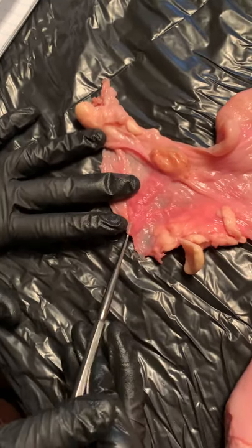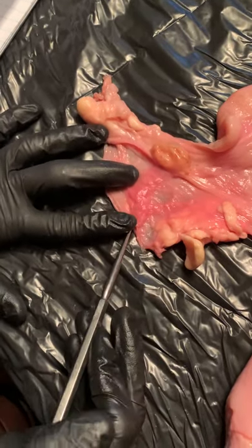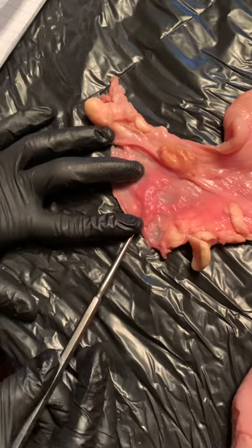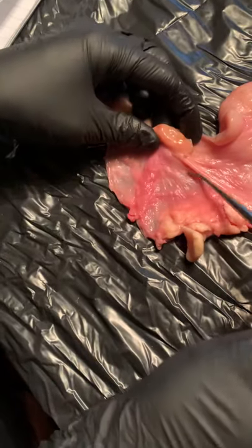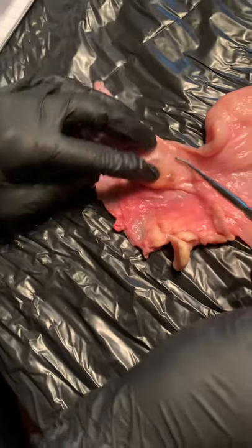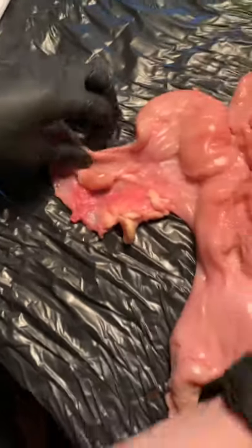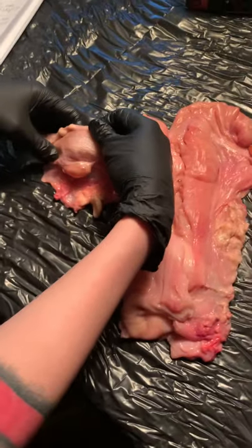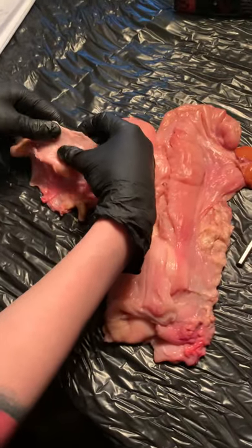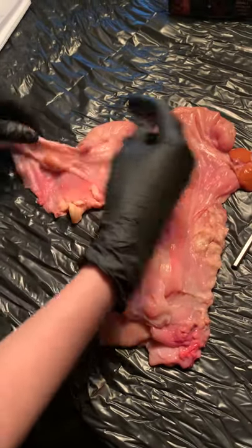The egg goes through this large tube and leads onto the ampulla and to the isthmus. This back here supports the oviduct, which is called the mesosalpinx.